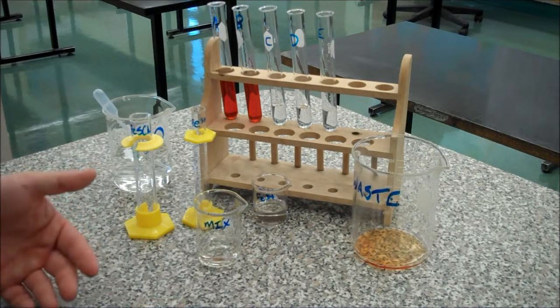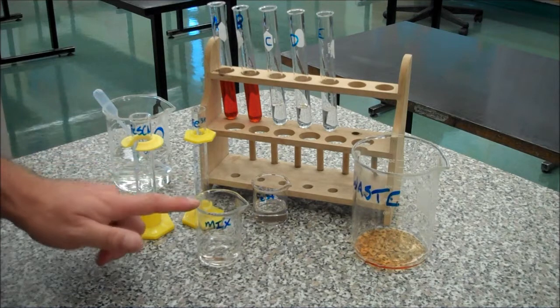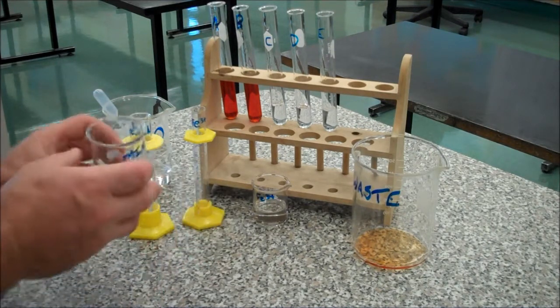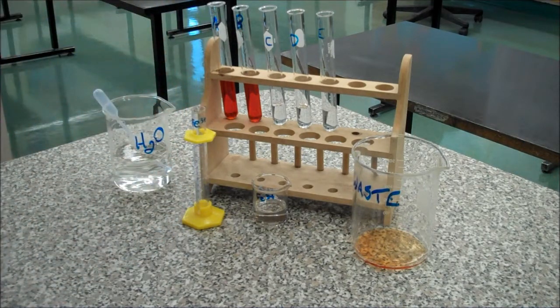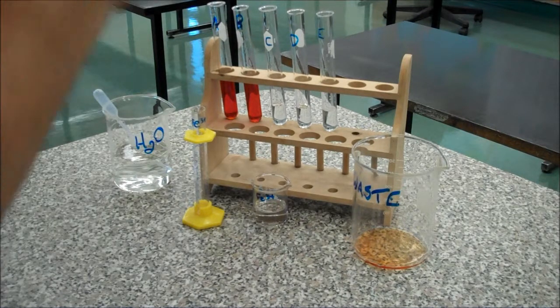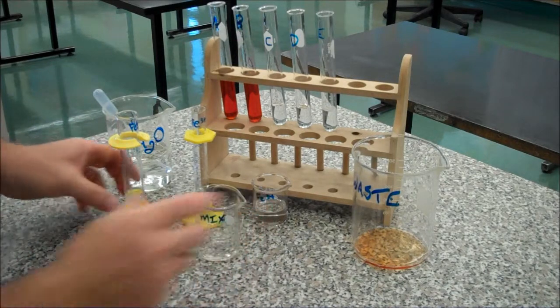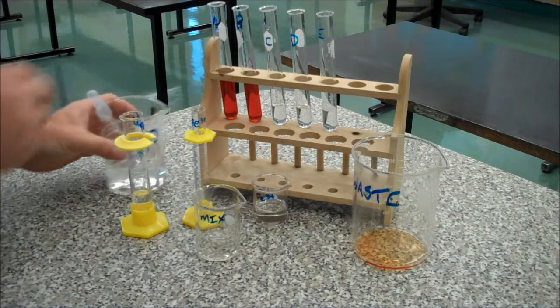However, I'm trying to make a dilution here, so since this had that mix in it, it's going to be okay to measure with. I'll take 10ml of this — this is my original dilution. I got it on the first try so I don't need to top that up. So there's 10ml. I will top that up to 25ml with distilled water, the same as I did before.